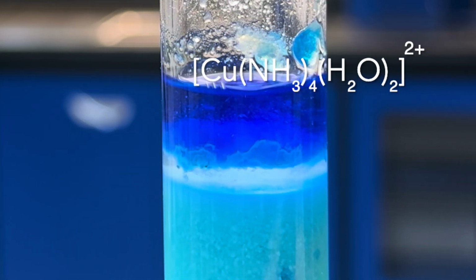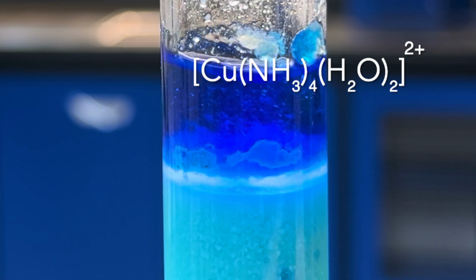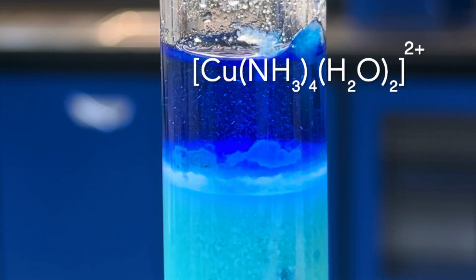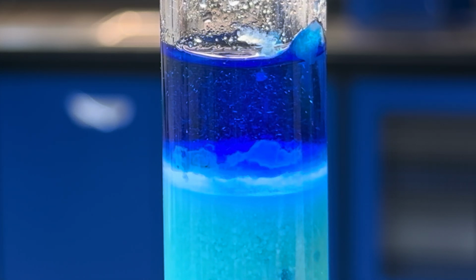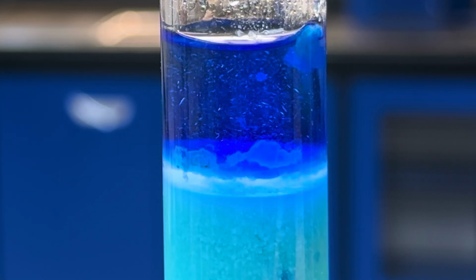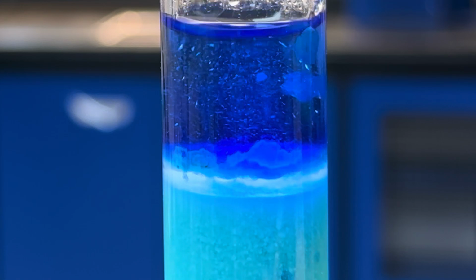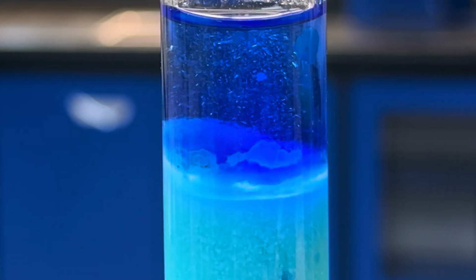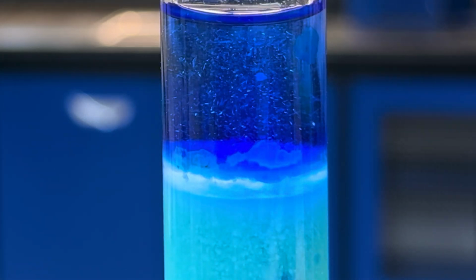This is because the ammonia is more stable around the copper ions. So as there always remains 6 of these ligands around the copper-2 plus ions, we can say that the coordination number around the copper-2 plus ions is 6, and it is a 3-dimensional structure. The 3-dimensional structure that forms is an octahedral shape.